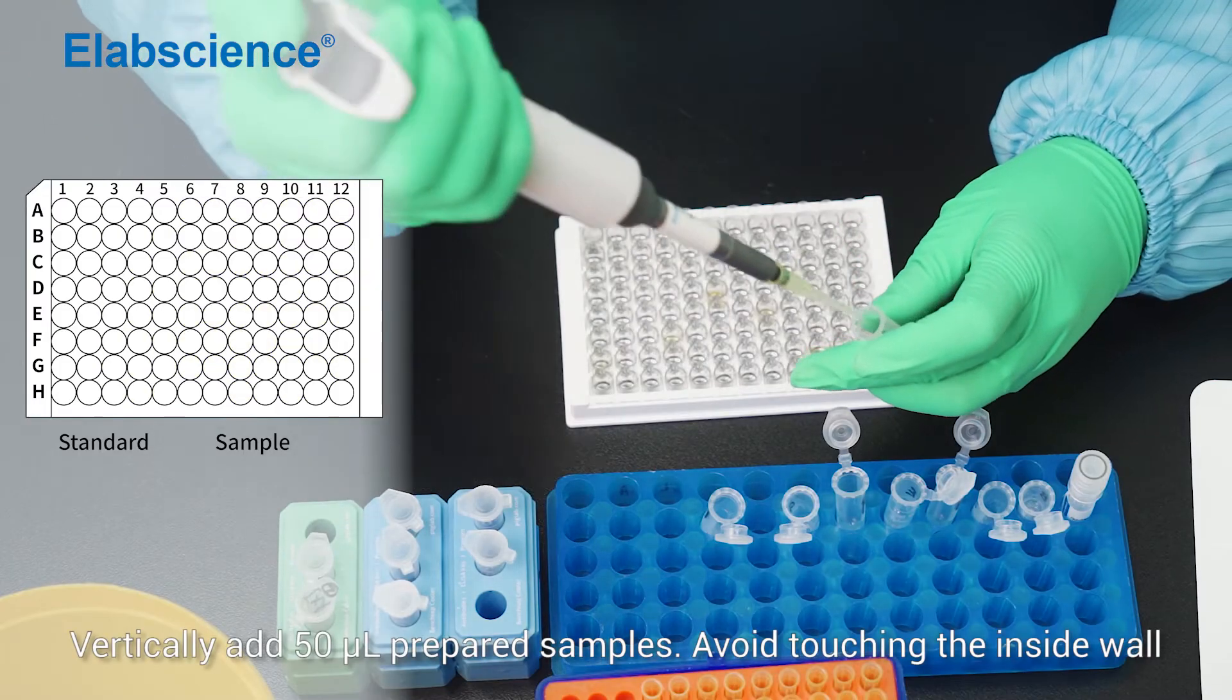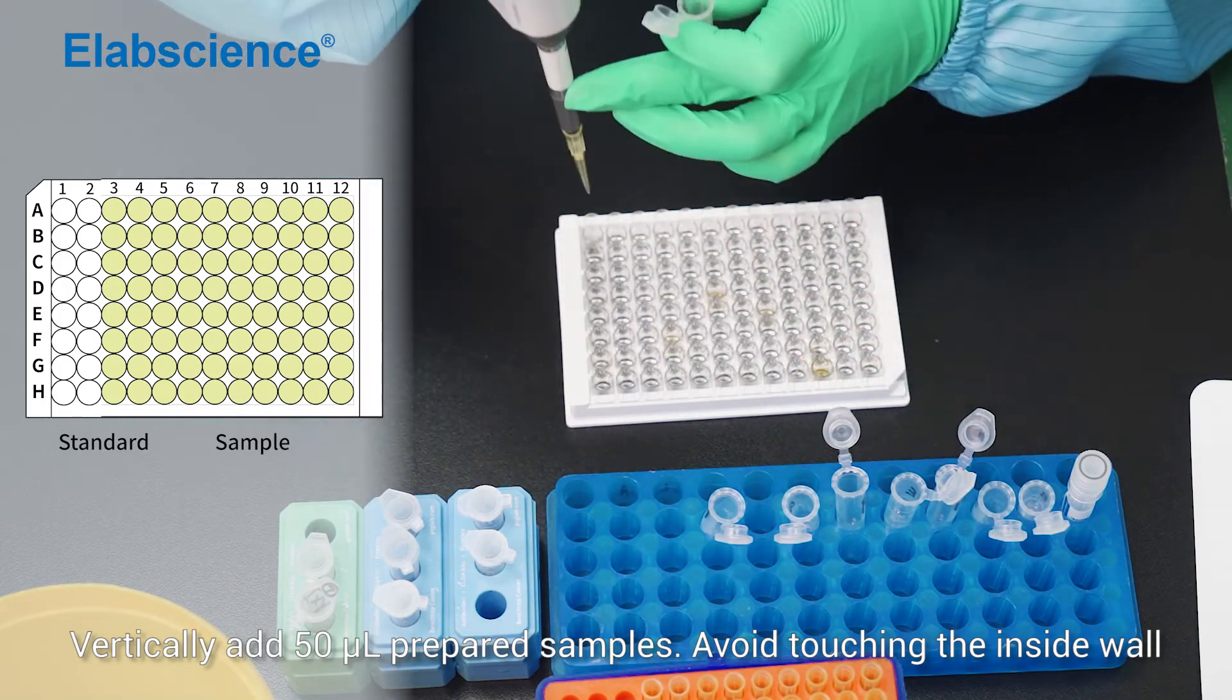Vertically add in 50 µL of prepared samples. Avoid touching the inside wall.